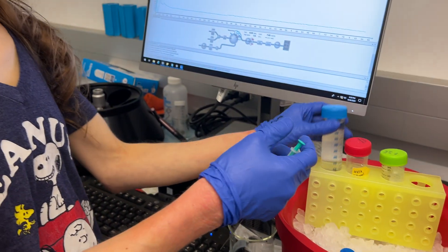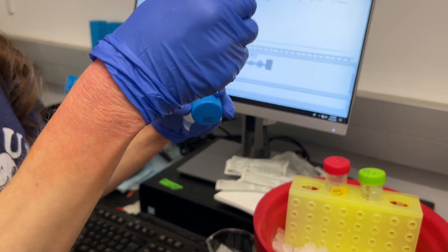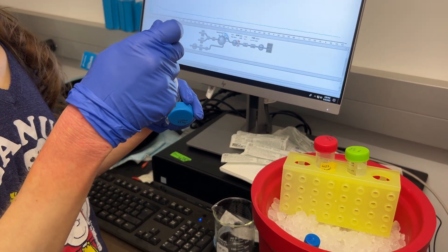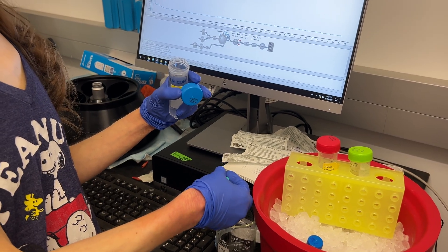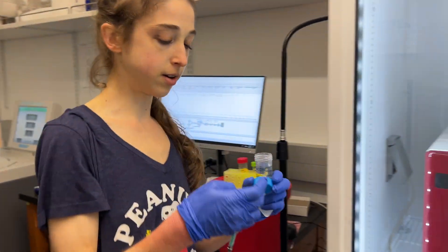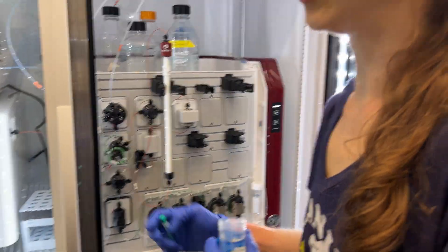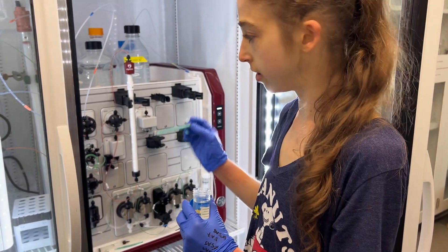And now we'll go ahead and go through the water. Now the next thing I want to do is wash the loop with the water. We're using a 500 microliter loop, and you typically want to do at least two to three loop volumes through the loop.